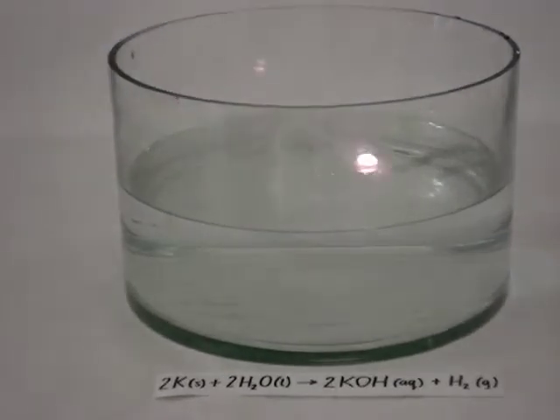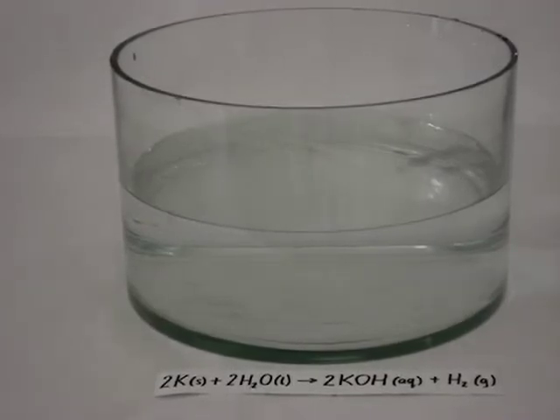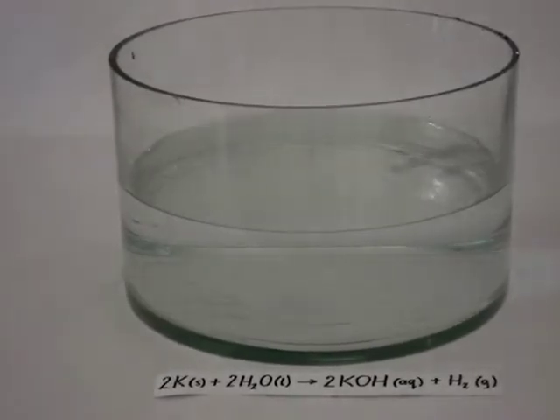You can see the exothermic reaction, and then you get a purple flame. Hydrogen was produced there, and the hydrogen exploded in the oxygen as it ignited.